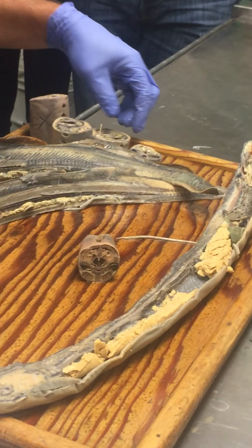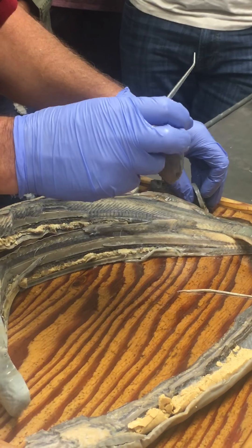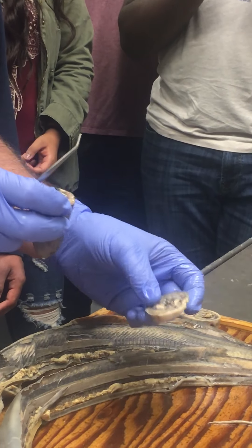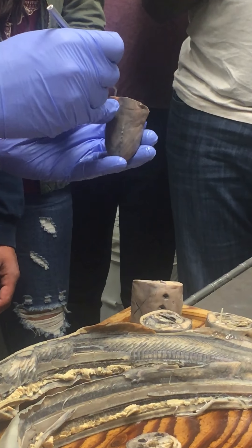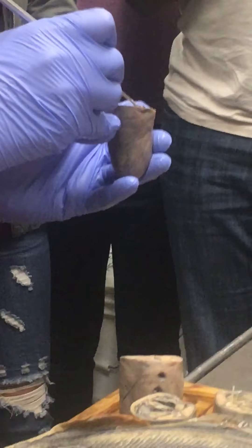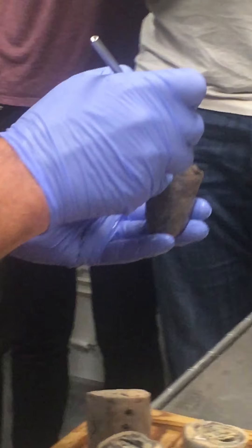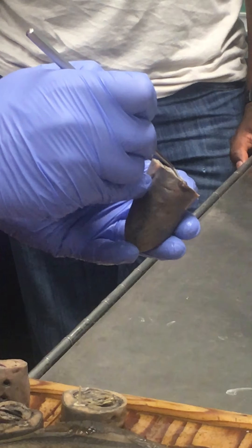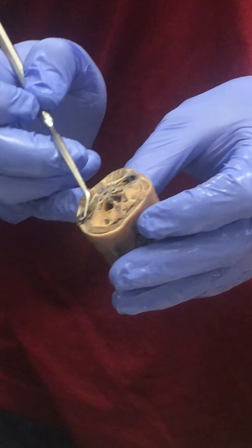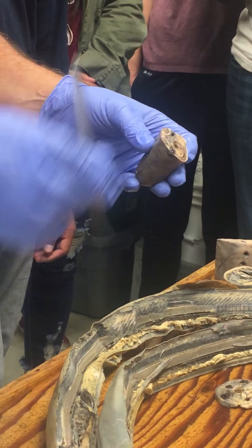I'll show you a couple of sections that had eyes. This is a section through the lateral eyes, and you can see them there. This one actually still does have a lens. The back of the eye inside is the retina. I'm not going to worry you too much over these parts on the lamprey, because we're going to see them in the shark — much better and bigger — and we'll do a full dissection of the eye there.